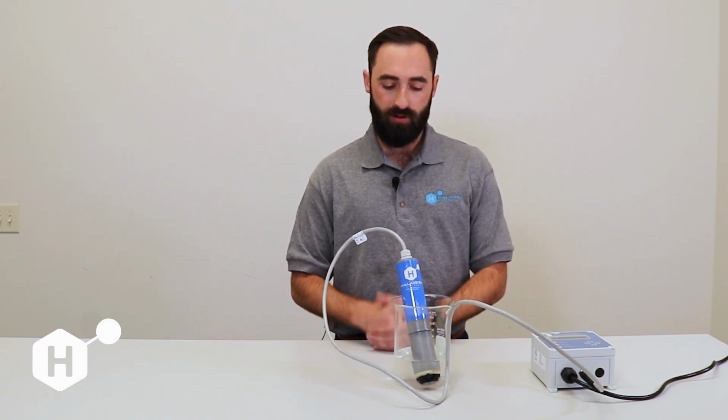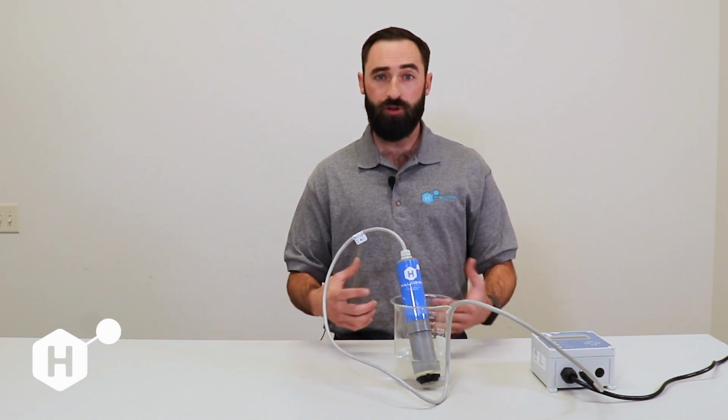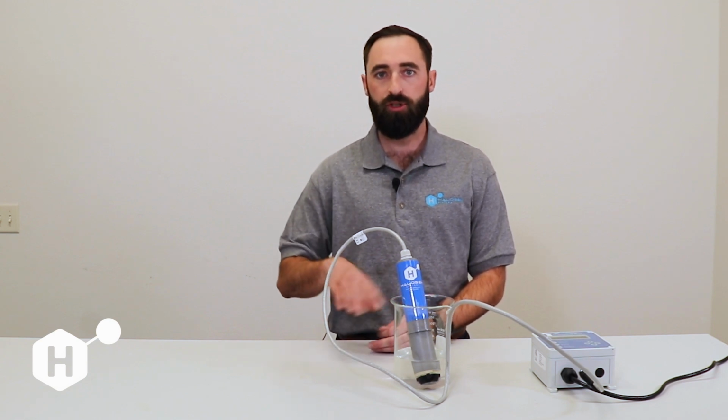And if you're in the field and you do a calibration when you're not quite ready, or you weren't sure if that calibration stored correctly, or you're getting really erratic and strange values, the first troubleshooting step is going to be to restore to factory defaults. That's going to go back to what we calibrated here in the factory, and it's a good fresh start for the sensor.